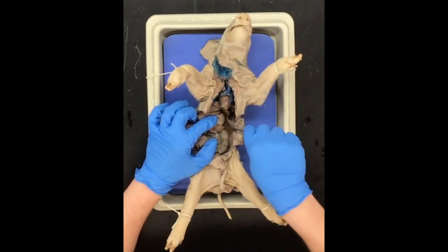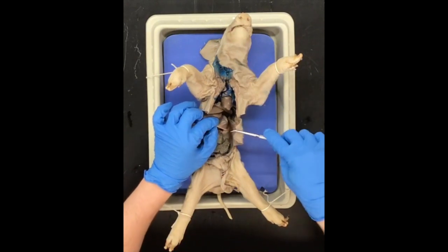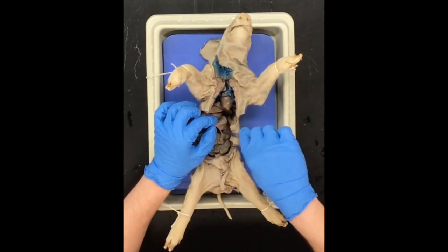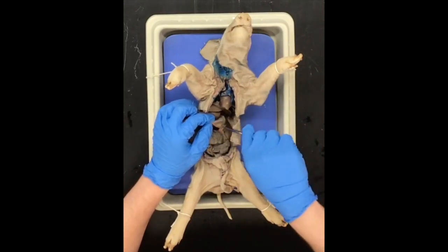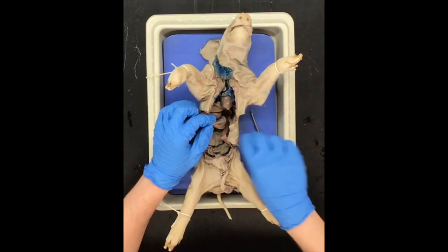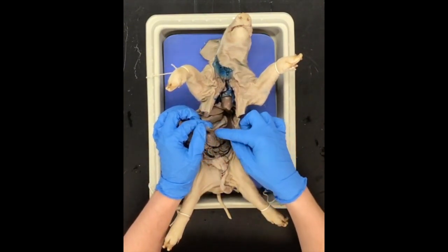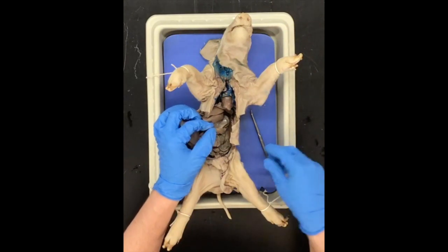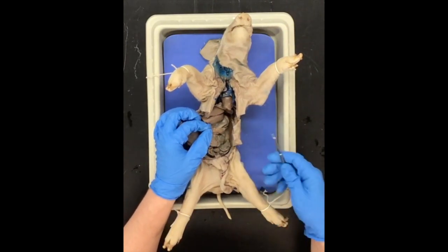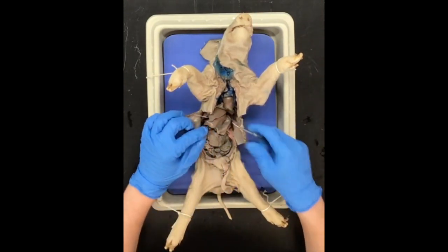Also back here we have the spleen. This right here is the spleen — let me use the probe to kind of detach it and break that connective tissue without disrupting any other organs if possible. Here we have the spleen. The spleen serves a role in our immune system — it helps generate white blood cells of certain types. So we have the spleen for immune support.